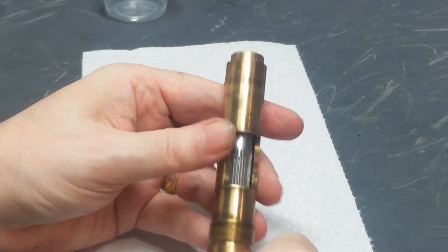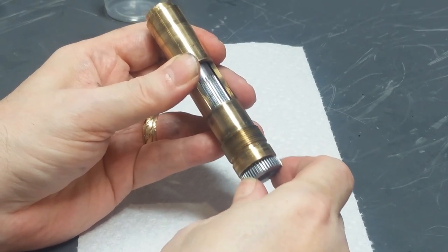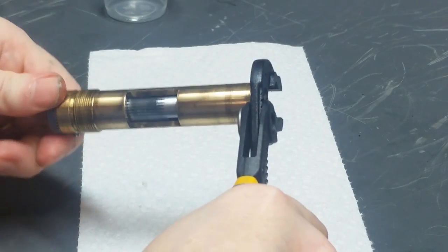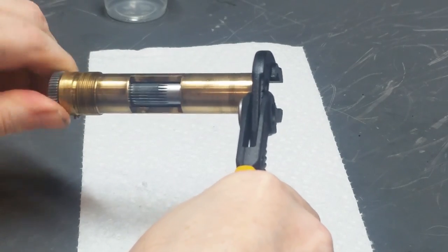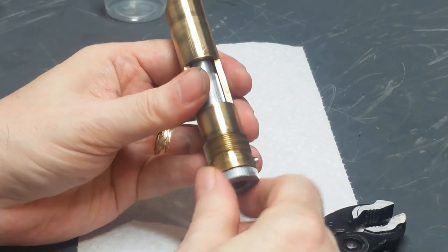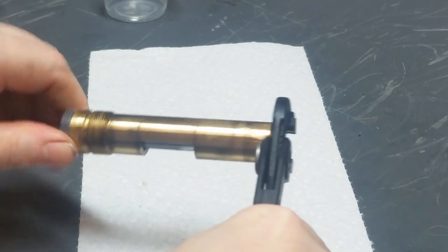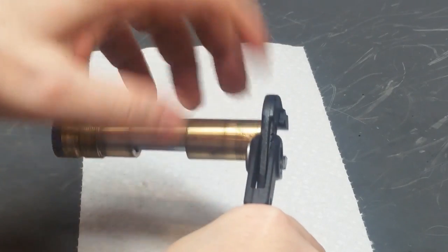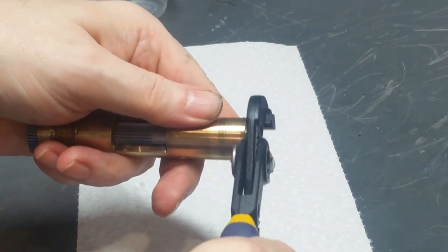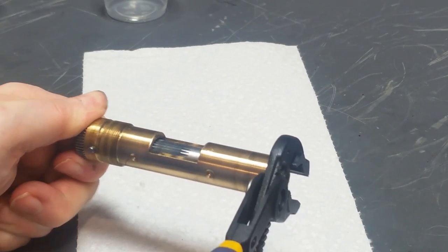Okay, so what you do then is you tighten it down. If you look here, there's still some lateral play, or there's still some axial play in that. It's not tightened down enough. So we keep going. At this point, there's just a little bit more axial play. Here, I've actually gotten to the point where it's snugged up. So if I try to rotate this, it's gritty and hard to rotate because I went too far with it. So once I hit this point, I back it up just a little bit.